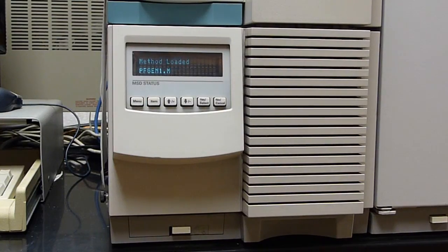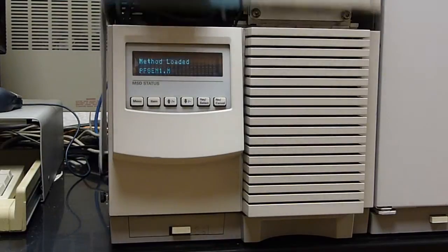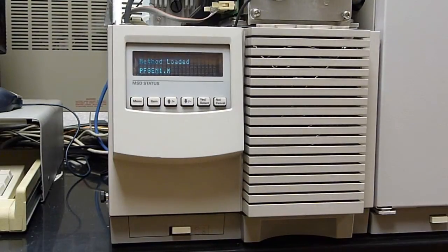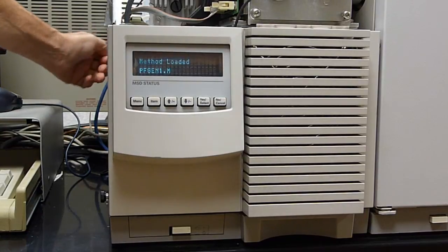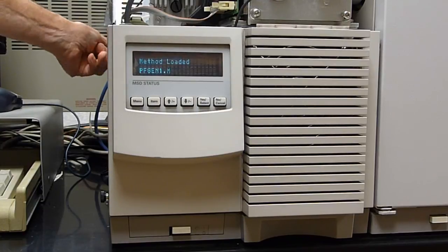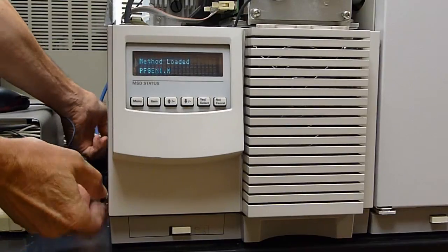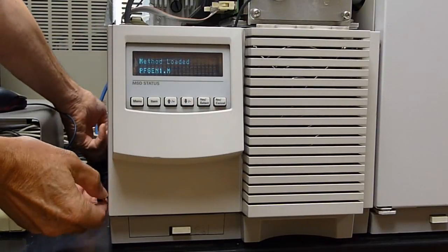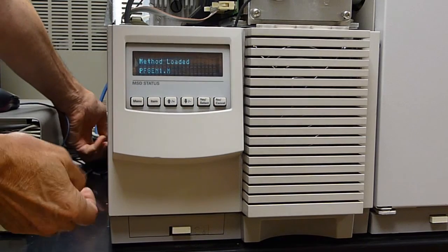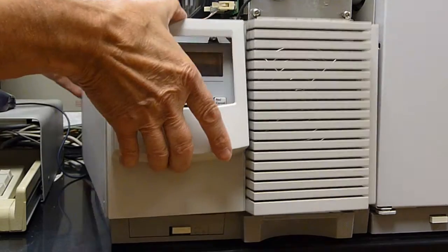Let's just quickly examine the diffusion pump setup. The air-cooled diffusion pump is behind here. We're going to take off the cover. Originally, this came with screws. I swapped them out for thumb screws. And I noticed in newer models of Agilent GCMSs, they also went to thumb screws.